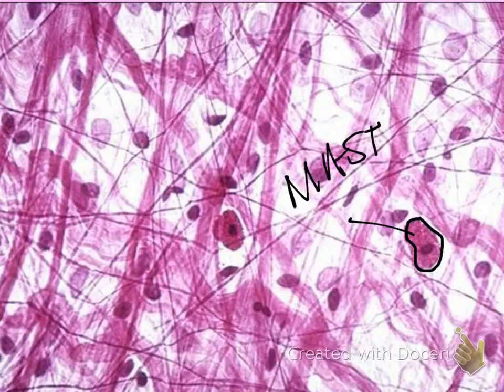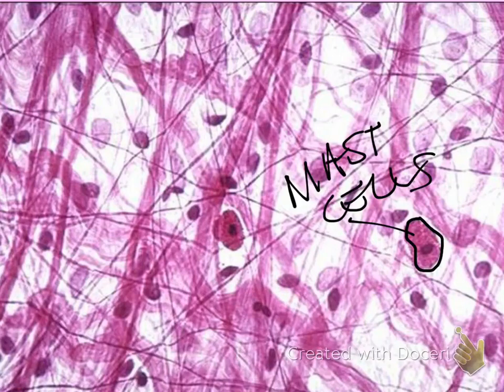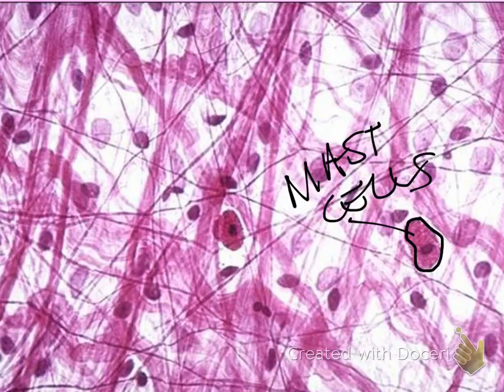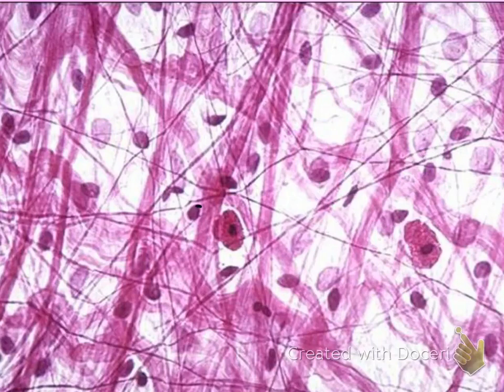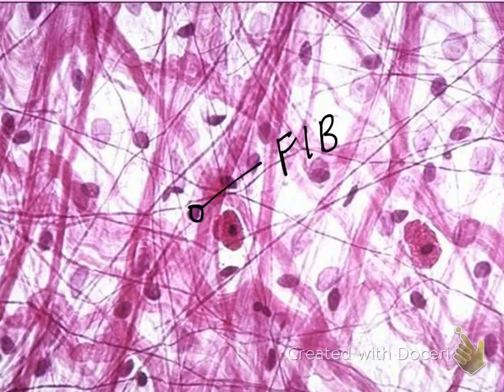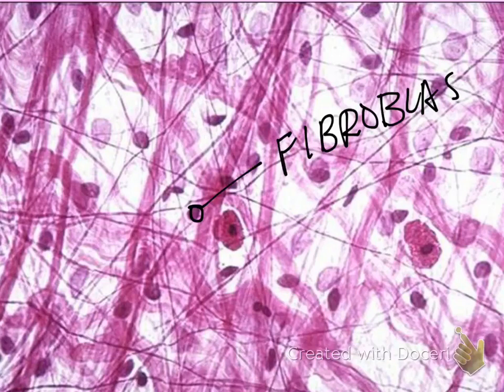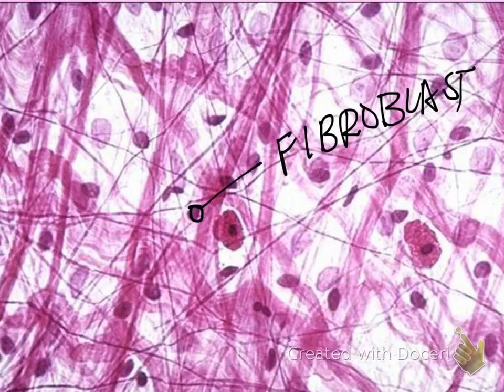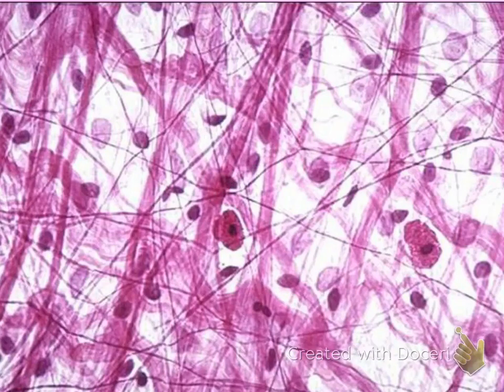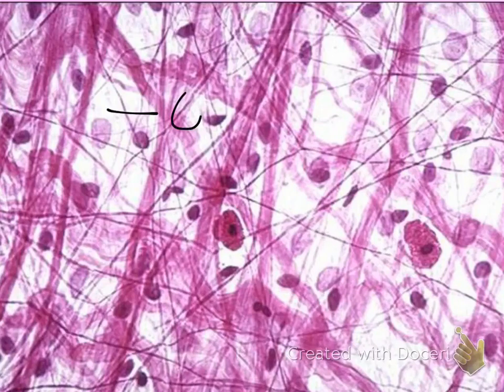Mast cells produce and release histamine in an allergic reaction. These darker, tinier cells are your fibroblasts, and their job is to make the collagen and elastic fibers. Lastly, the light white background is your ground substance.